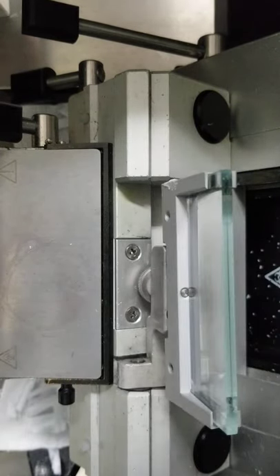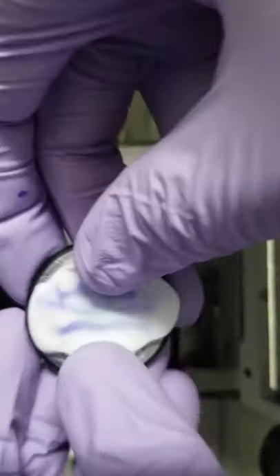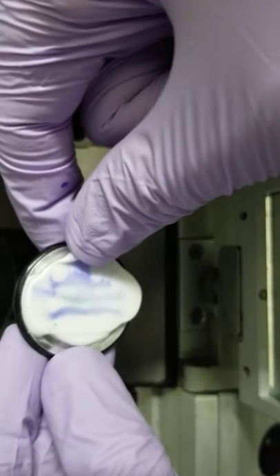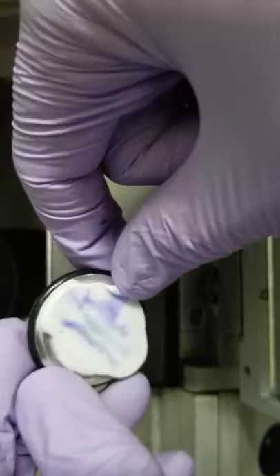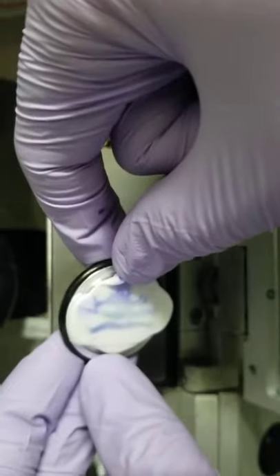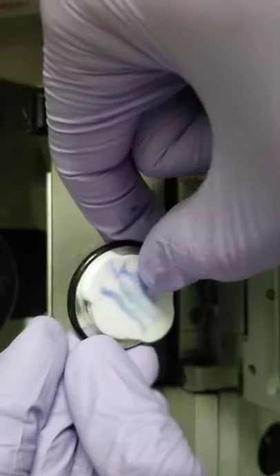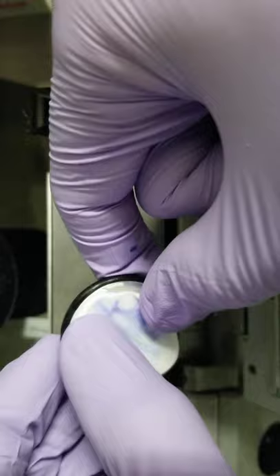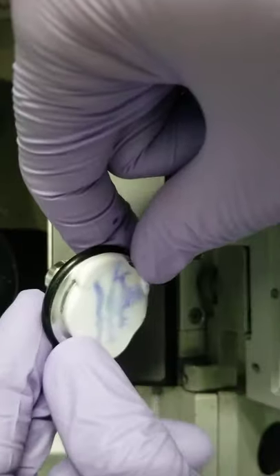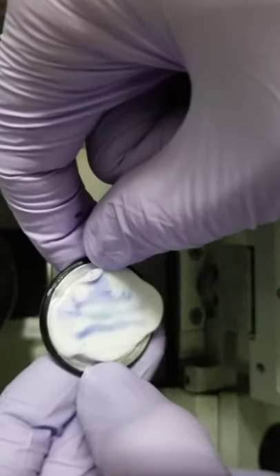And now I'm going to switch over for the second layers. You can see it under there, the blue. You want to process them vertical. Some people say at an angle or this or that, but let's say this is the epidermis side. If you process it straight up and down, that won't curl. It should stay completely flat. If you process it like this, you're going to get some rolling up towards the top. If you process it at another angle, you're going to get the entire edge of the epidermis to roll down. But if you process it vertical, it should keep everything linear.